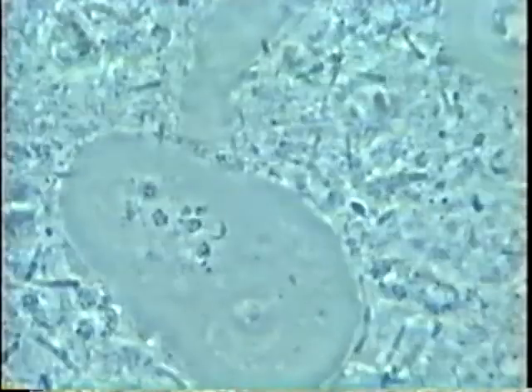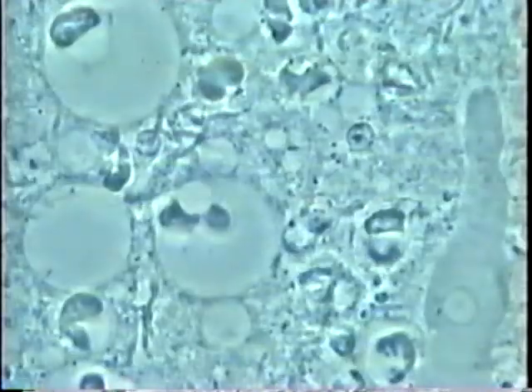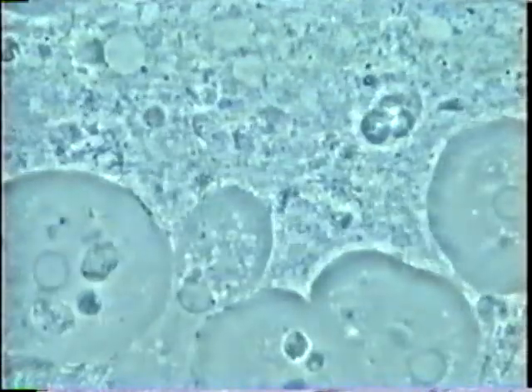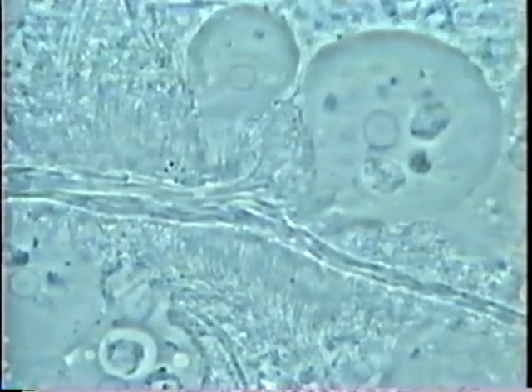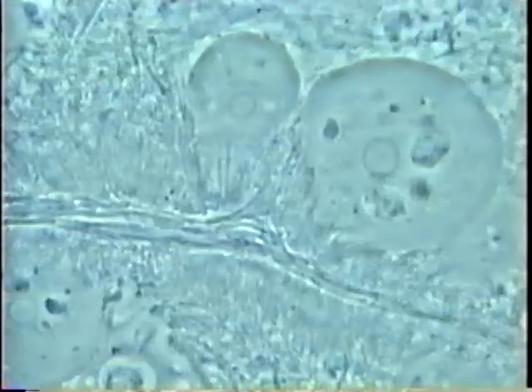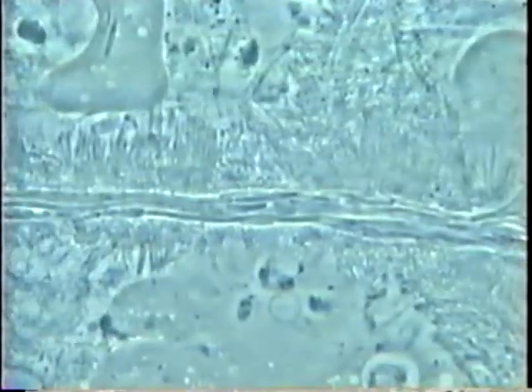You see enormous amoeba, enormous protozoa. They act like larvae going everywhere and are very active. We see here again a lot of long filament motile bacteria, and you can see the parasite almost suctioning — very active — alongside those bacteria.